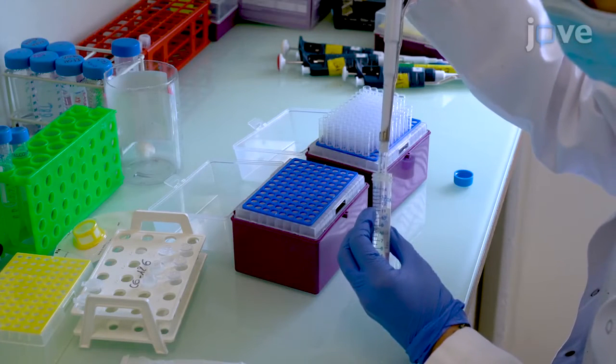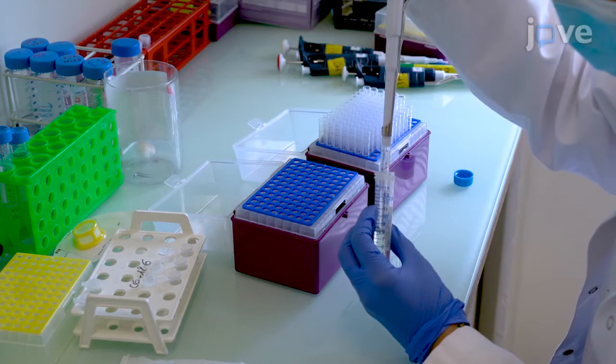Coat tubes and pipette tips with 5% BSA solution, which will enhance recovery of the nuclei.